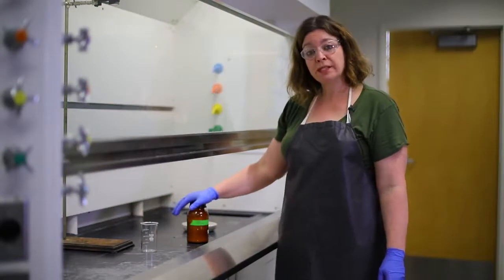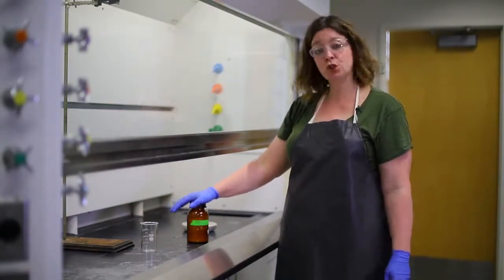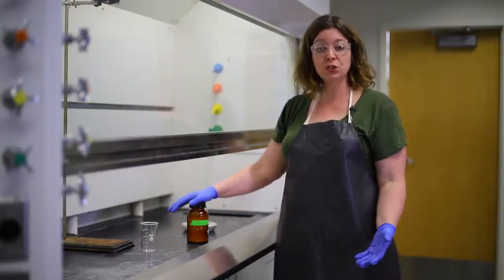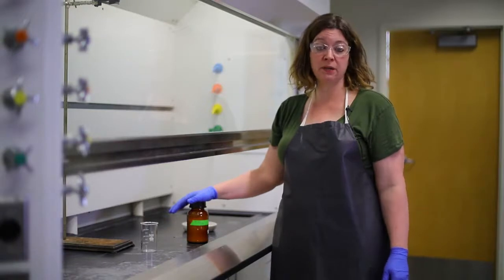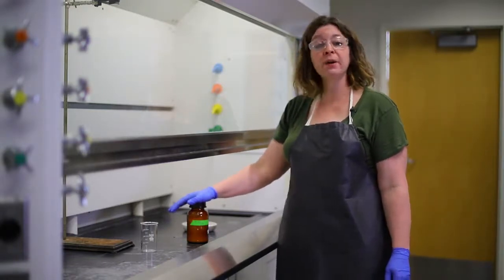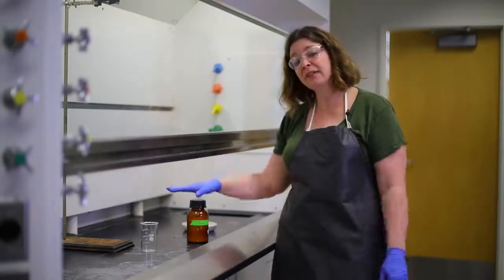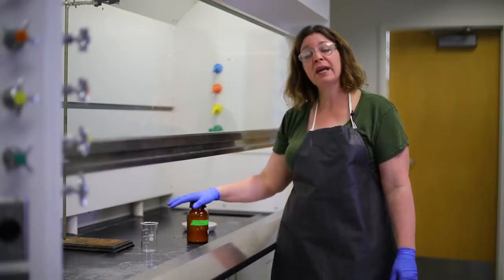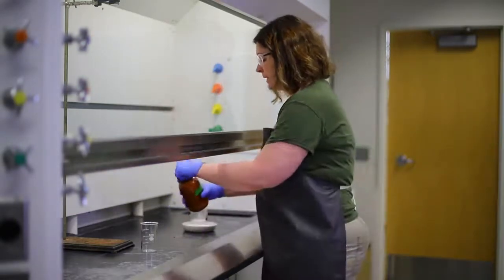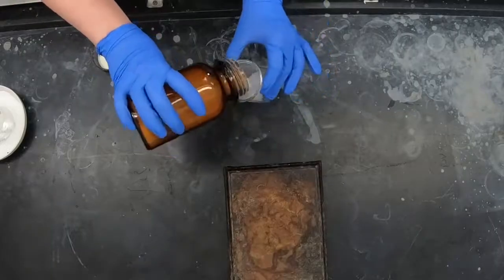In this corrosion demo, we're going to show you the effect of a strong acid on sugar. Sugar contains carbon, hydrogen, and oxygens, much like a lot of different organic material. Your skin, your hair, your clothes, all are made primarily of carbons and hydrogens and oxygens. So this will kind of simulate the worst case scenario of what would happen if you were to get a strong acid on you. So I'm going to take just regular table sugar and pour it into a beaker.